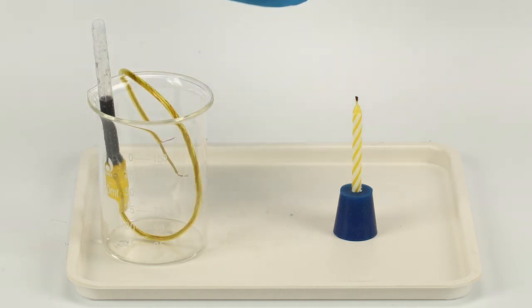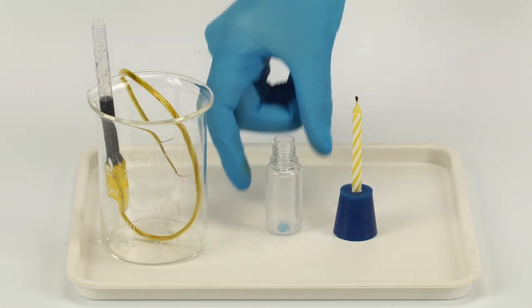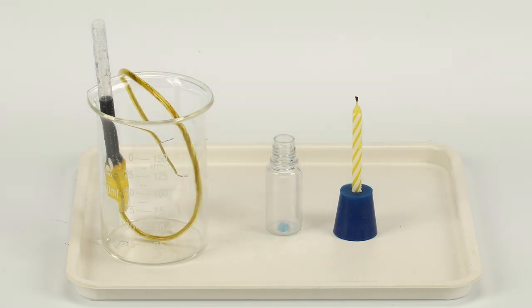Pop! Electricity disassembles water into a mixture of hydrogen and oxygen gas. This mixture is flammable and readily ignites when exposed to flame. The reaction is powerful enough to blow out the candle.